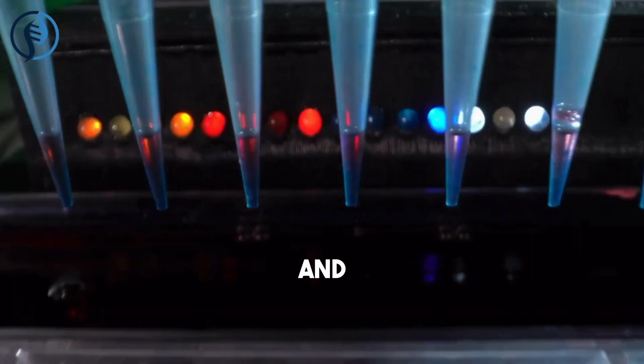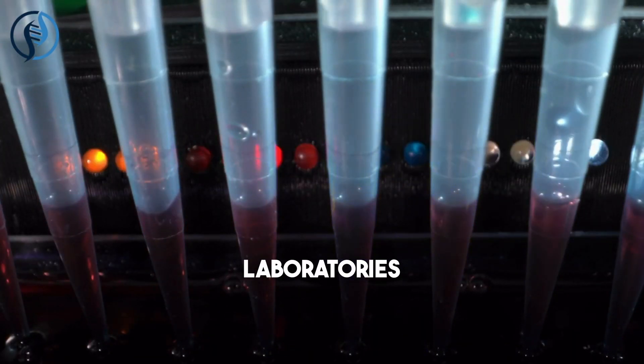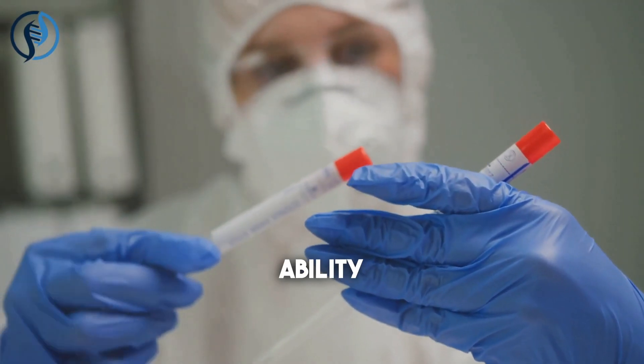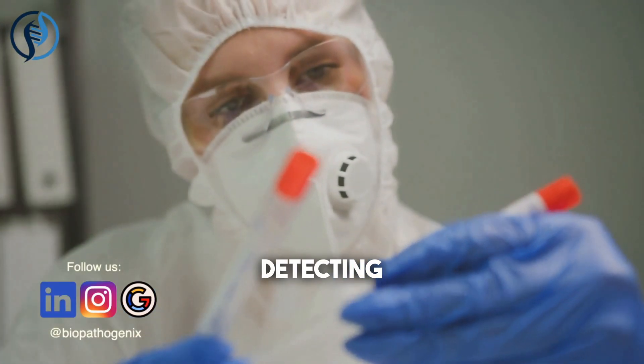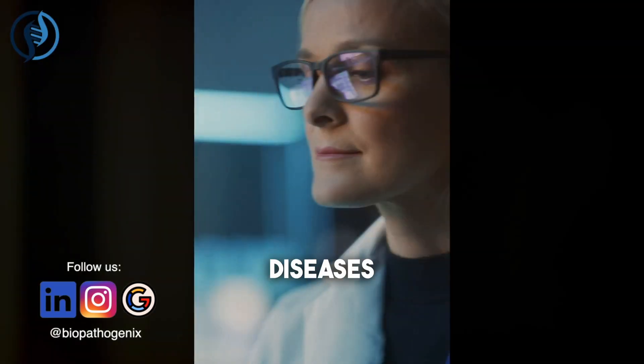influenza and SARS. Clinical laboratories have widely adopted RT-PCR for its ability to diagnose patients by detecting and quantifying infectious diseases.